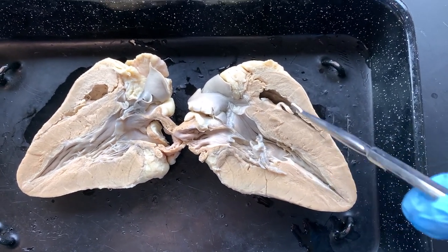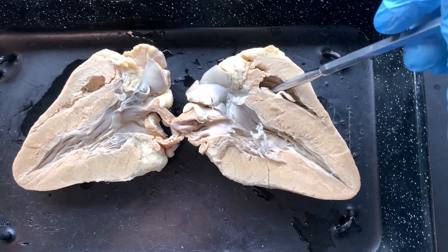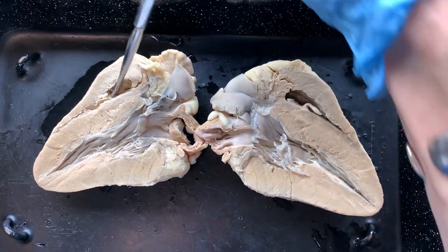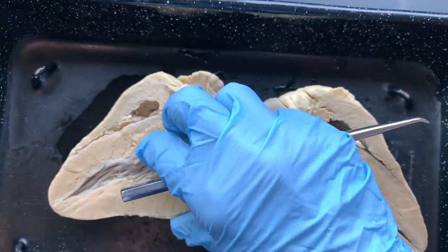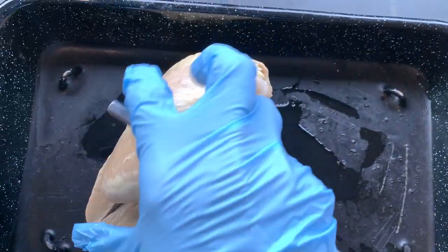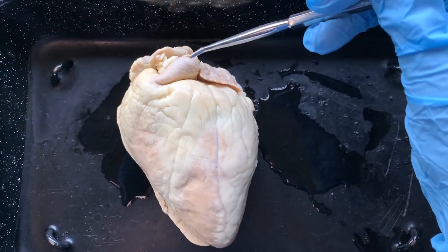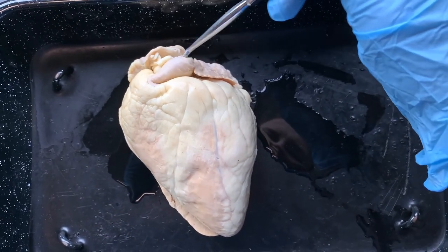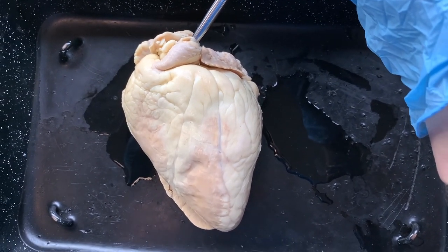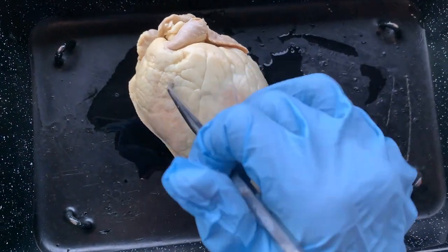The smaller of these two cavities or rooms or ventricles is going to be the right ventricle. The smaller one on top is the right ventricle — it goes on a bit inside but it's still smaller than the other room. Here it is on the anterior surface again. Here's the pulmonary trunk. If I know that this is the pulmonary trunk and the pulmonary trunk is on the right side of the heart, then this must be the right side of the heart and this is the smaller side. Keep your eye on this side and let me open the heart.